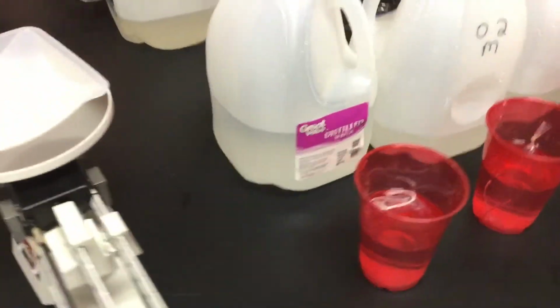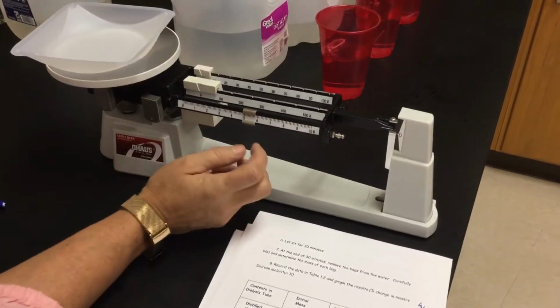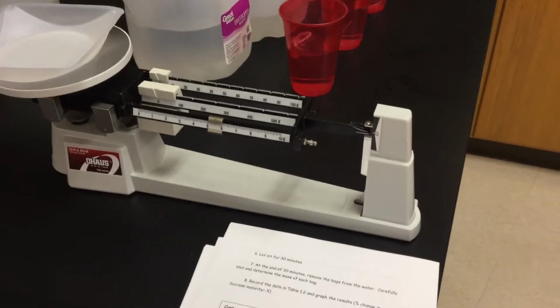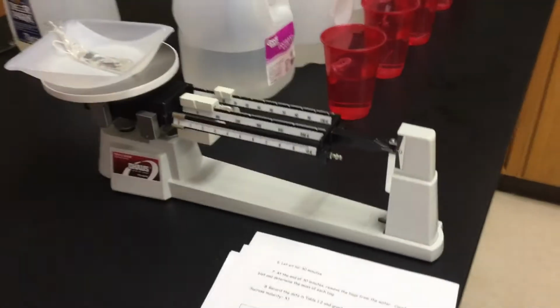We're up to 0.8. I'm going to reset just to make sure. Okay, so we figure about 20. So let's go over to my 20 mark. That's where we were last time.